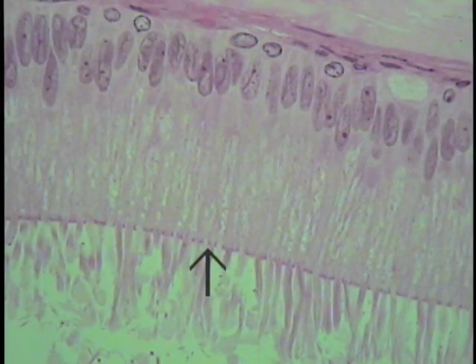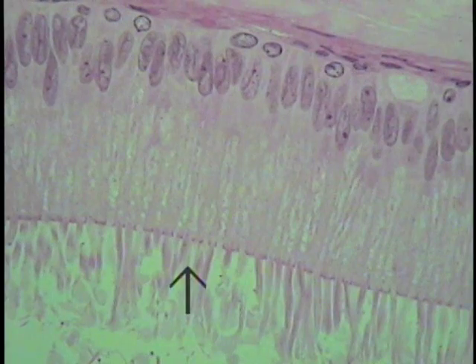And look very carefully in this particular section, one can make out numerous tight junctions, or these terminal bars, these intense little lines at the apical surface. So that gives you the width of the apices of some of these cells, which you can see are quite narrow. So the distance between two of these terminal bars is the apical extent of a cell.